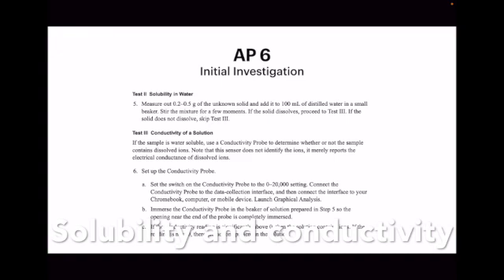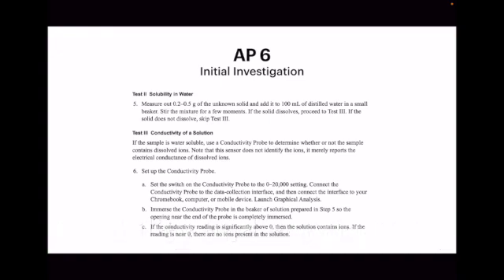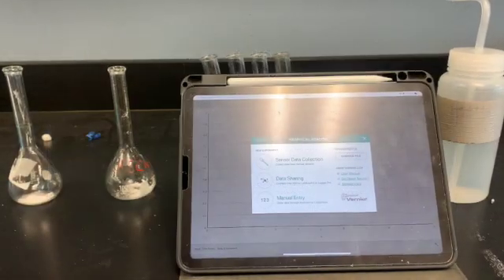Then you have the conductivity of the solution. You've used the conductivity probes, you're familiar with it. So we can take that solution that we've already made, and we can put the conductivity probe in there and find out, does it conduct electricity, and if so, is it high conductivity or low conductivity? And that helps us point to what it might also be.